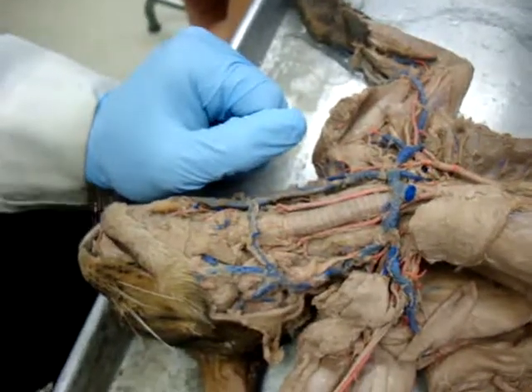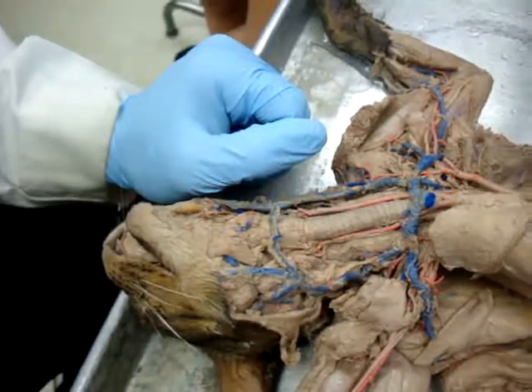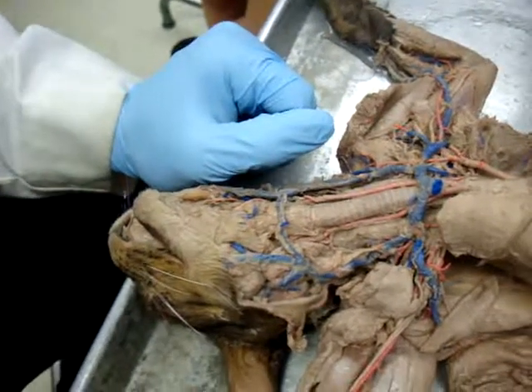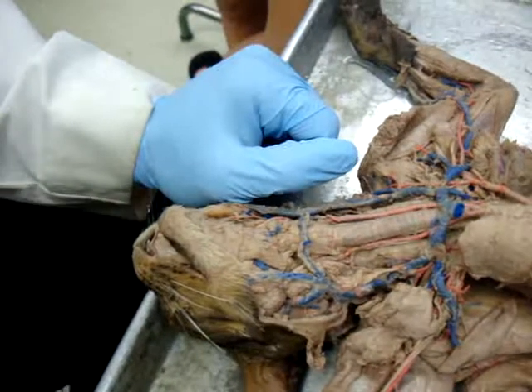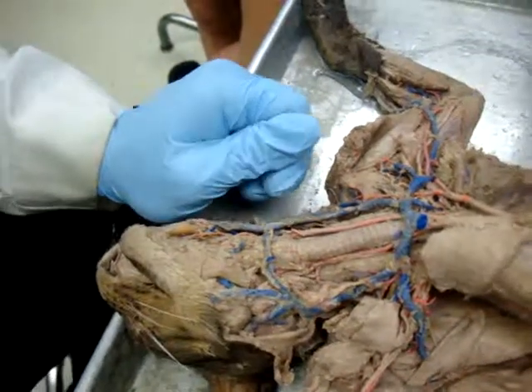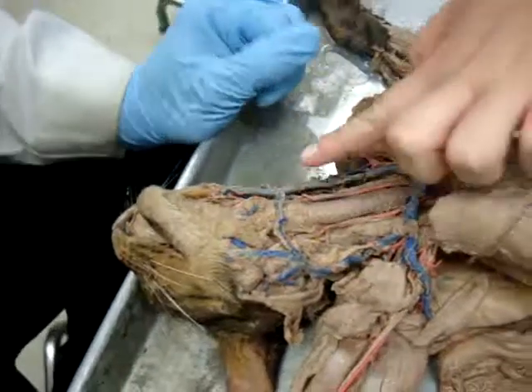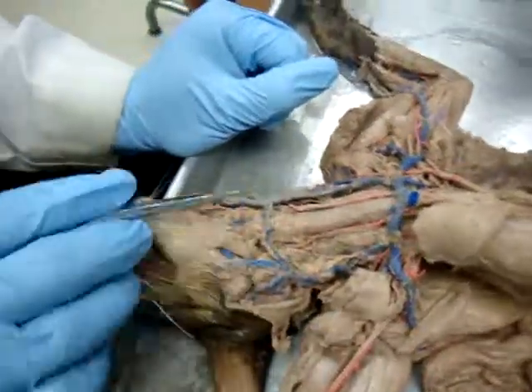So if you look at a human, you've got three different jugulars. You've got an anterior jugular coming down here and there. And you've got your internal jugular right there, and an external jugular just laterally to it usually. So the average person has 6 different jugulars. They've got left and right and then 3 each. So the transverse one was right here. Right, so there's transverse jugular.